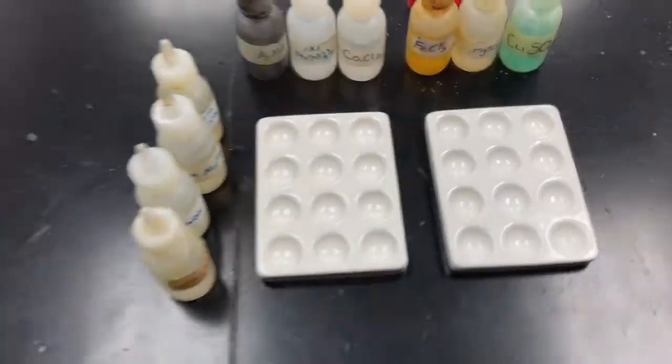Okay? Now, after I mix these chemicals together, there's going to be a couple possibilities. Number 1 is that maybe they don't react, and that's possible. It's possible that when chemical 1 and chemical 2 are put together, there's no benefit for them to react, so they don't. And so you wouldn't see much of a difference. If that was the case, then in our table, we're probably going to write something like no reaction or the initials NR.